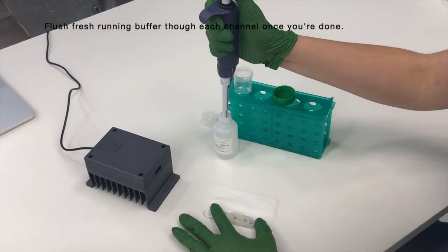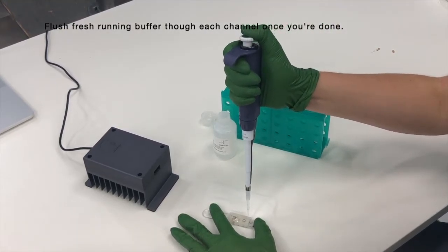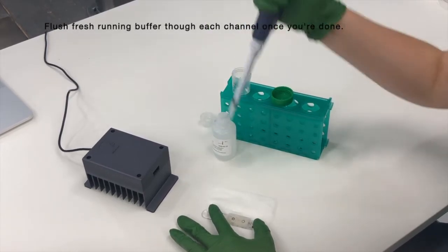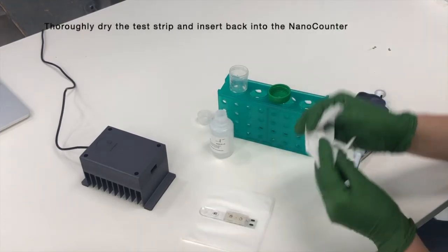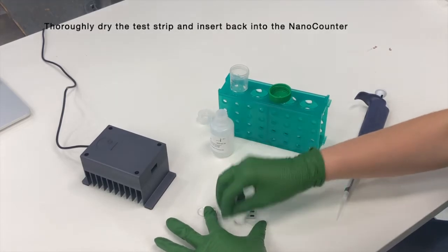Flush fresh running buffer through each channel after you are done to push out any air bubbles that were introduced. Dry the strip and insert it back into the nano counter and turn on voltage to see if the clog is cleared.